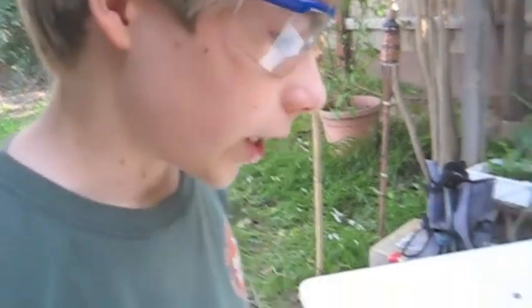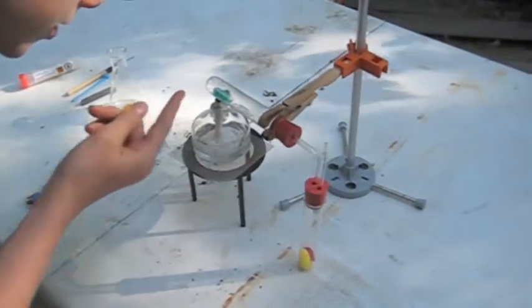So far everything down here looks the same. Now our reaction is complete. As you can see it's now all copper sulfate and it has apparently magically turned blue.